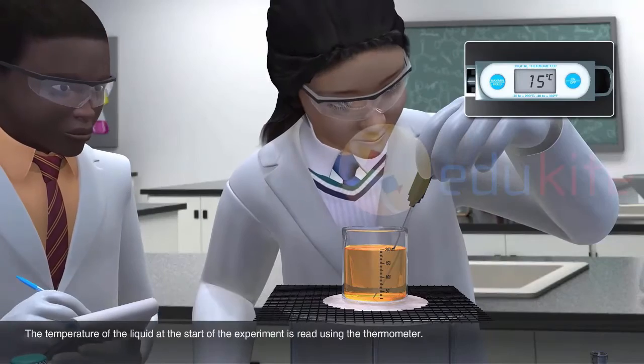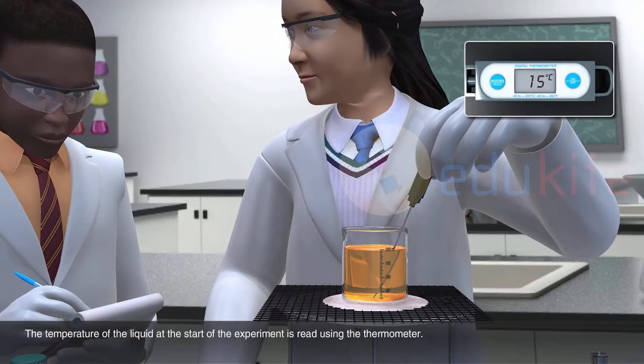The temperature of the liquid at the start of the experiment is read using the thermometer.